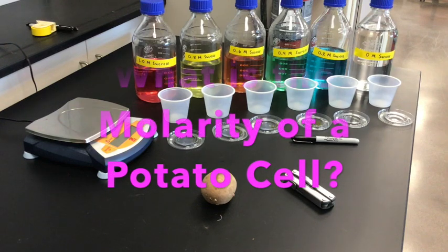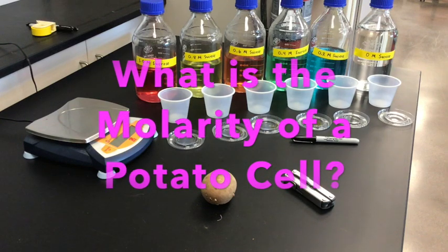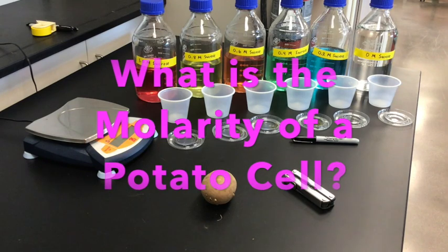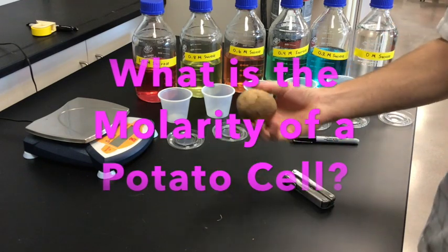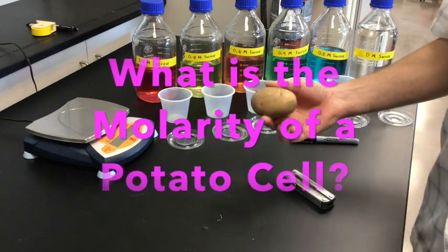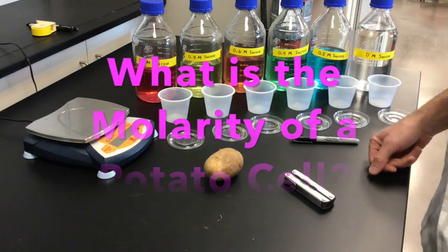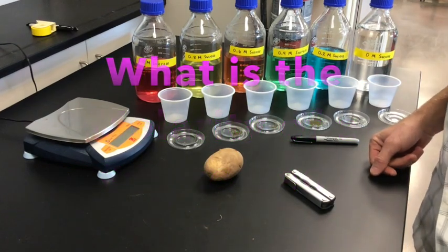Hello, this is Mr. Buss, and in this video we're going to go over a lab where we determine what the molarity of a potato cell would be.